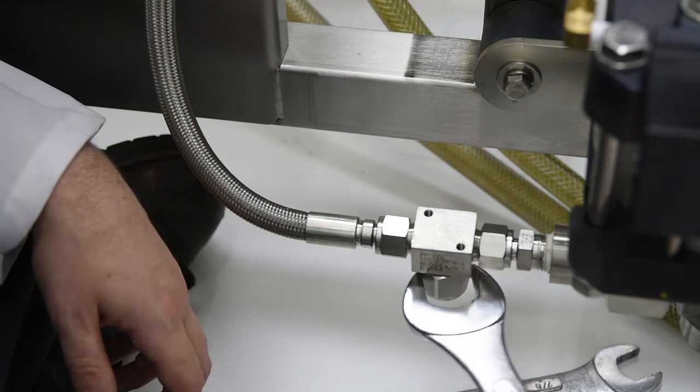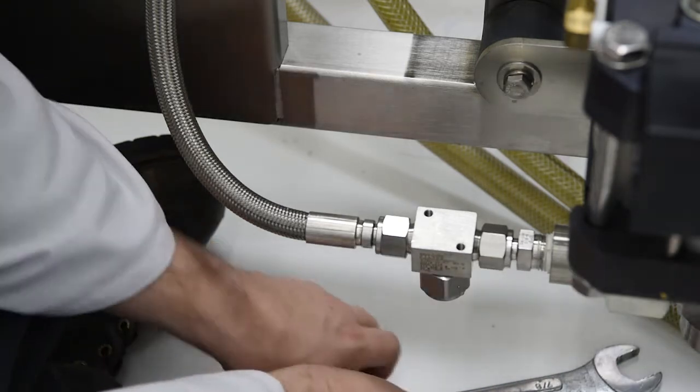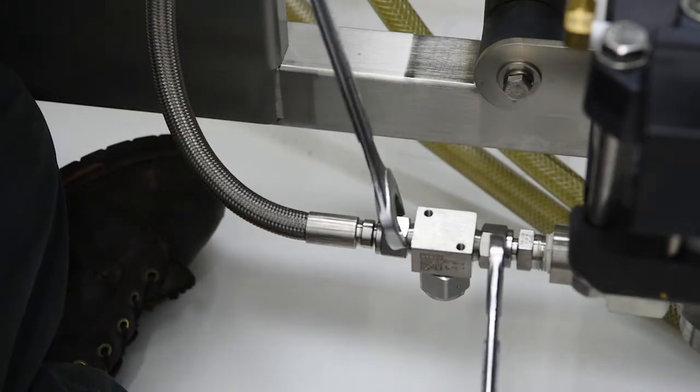First, using the 1 1/8 inch or the adjustable wrench, loosen but do not remove the cap from the filter.